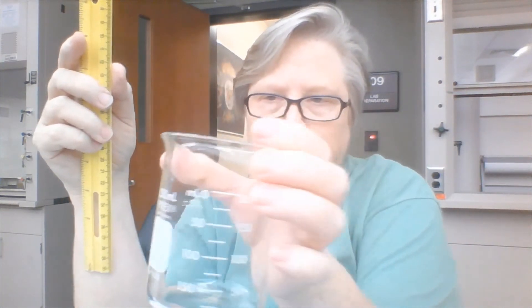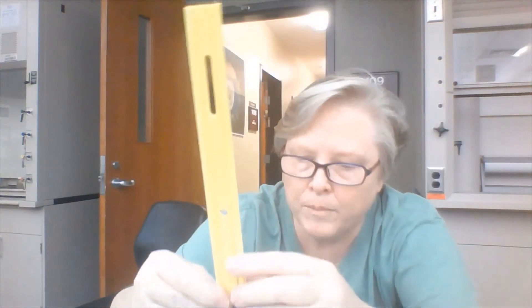The first thing I'm measuring is a beaker. And it helps to put the zero at the bottom. And so I get right about 9.15 centimeters.